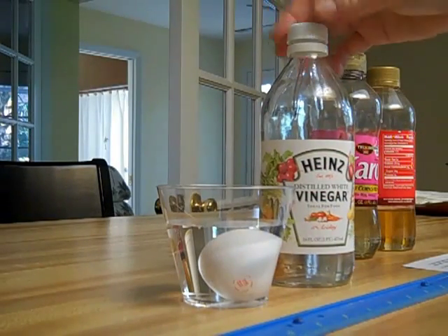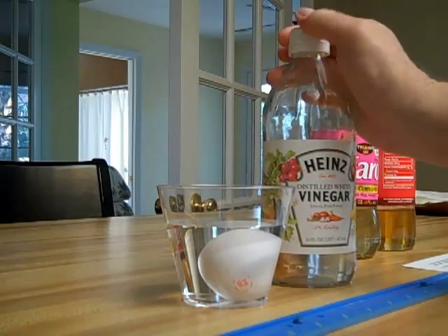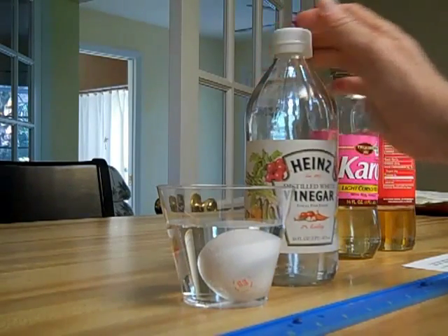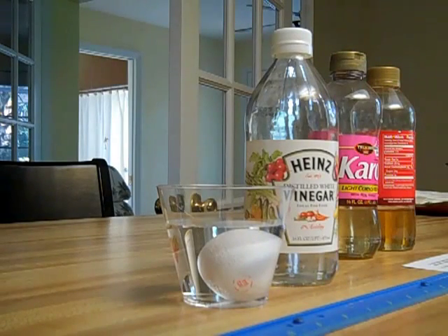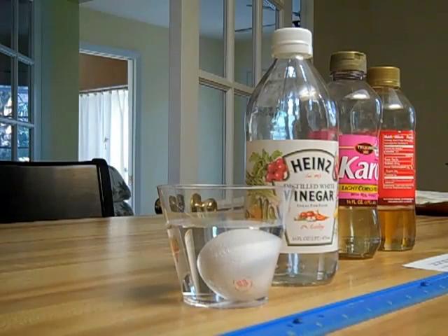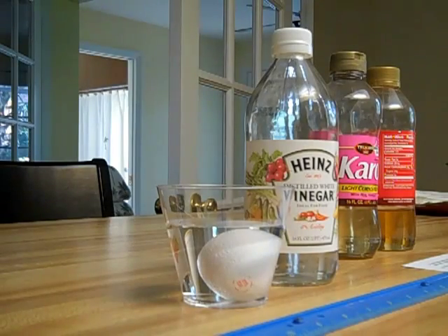This takes about 12 to 24 hours for the shell to dissolve. We'll come back at that point, take another measurement, and replace the vinegar with water.